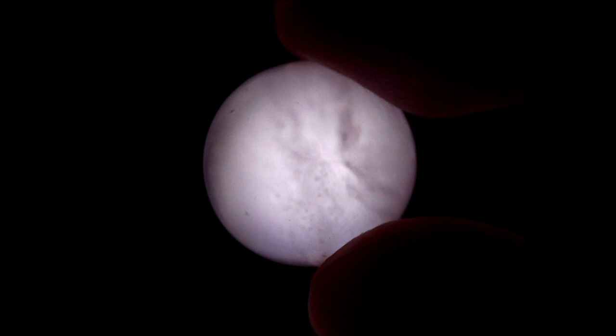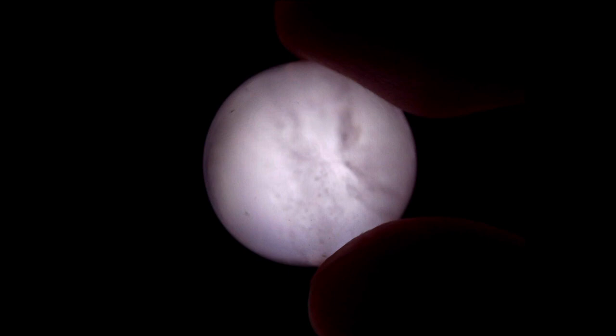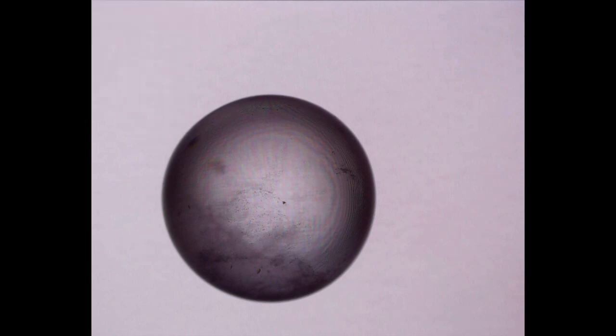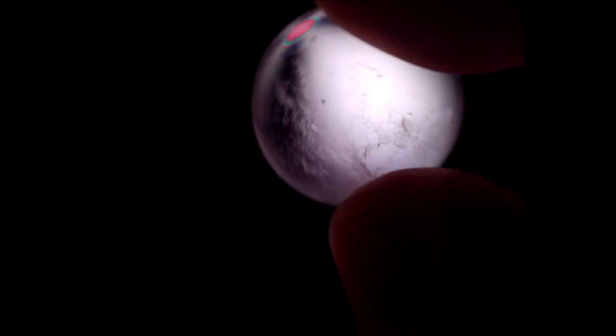We've now taken a look at the most important views of our quartz sphere — looking down the C crystallographic axis and looking down the plane of the A axes. One of the benefits of the quartz sphere is that we can take a whole bunch of different views through our sample. Let's reset to plane polarized light, bring in our upper polarizer, and view our sample in a variety of different orientations to get a sense of the different sorts of views when we're not exactly looking down the plane of the A axes or the C crystallographic axis. What we're seeing here is an off-centered uniaxial optic axis interference figure, though it's hard to keep the sphere rotating in the same plane so we're wandering around a bit.